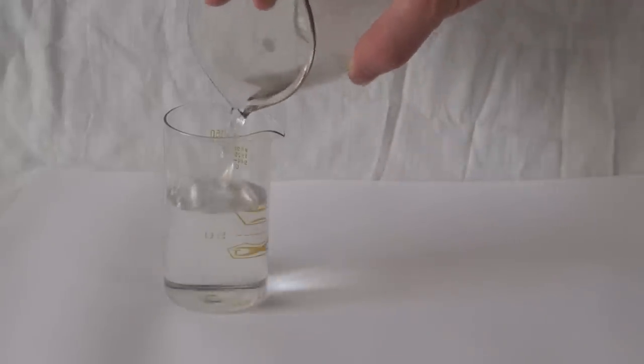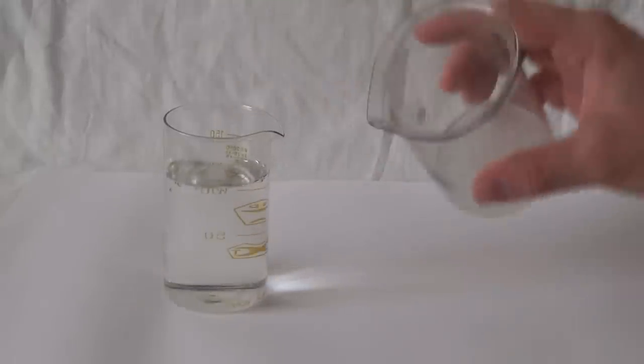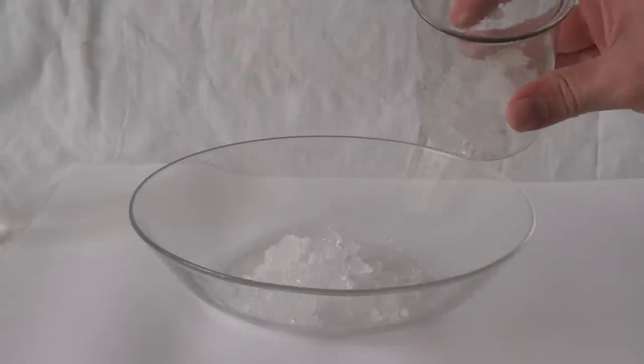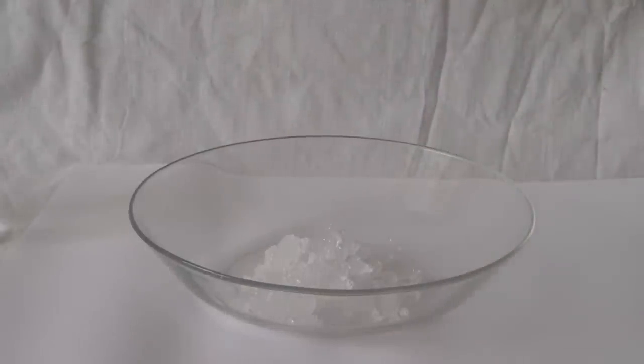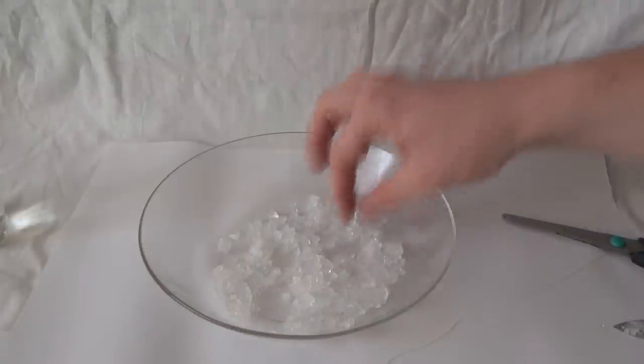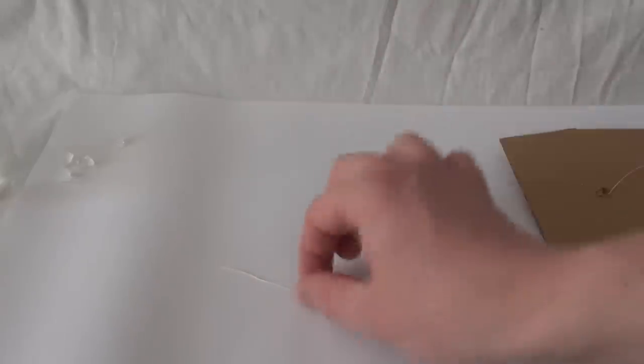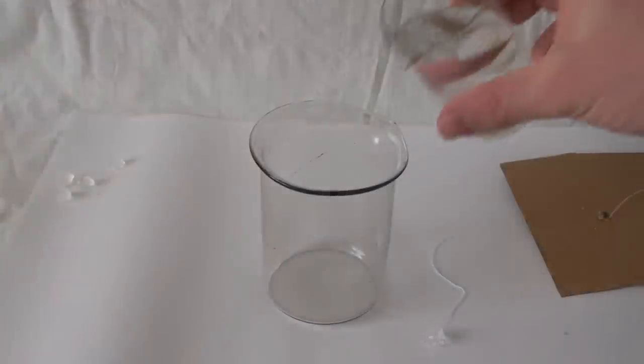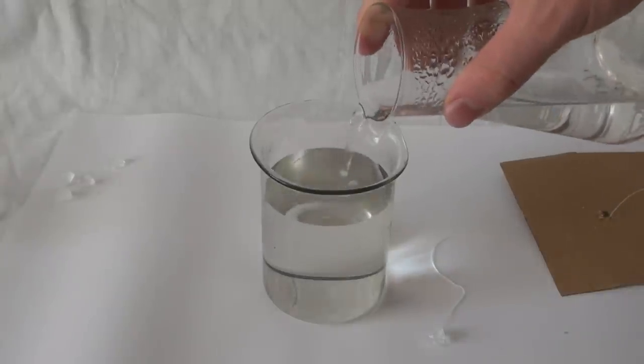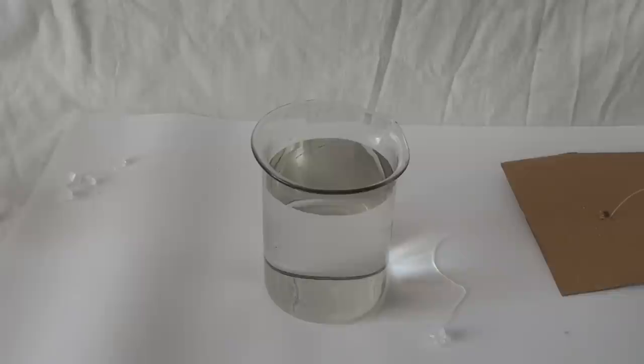Now, let's merge the solution into another beaker. Next, choose the most beautiful and large crystal from the mass of crystals that were formed at the bottom of the cup, or the one that is easier to tie on a thread. I could also advise here to use a thin fishing line instead of thread. Once we have tied a crystal to a thread, we pour our saturated solution of salt back there. You can tie a thread to a regular pencil and hang a crystal in a glass using it.